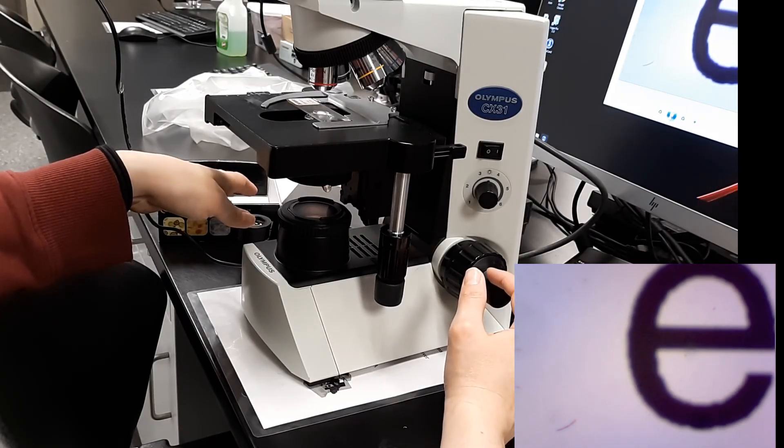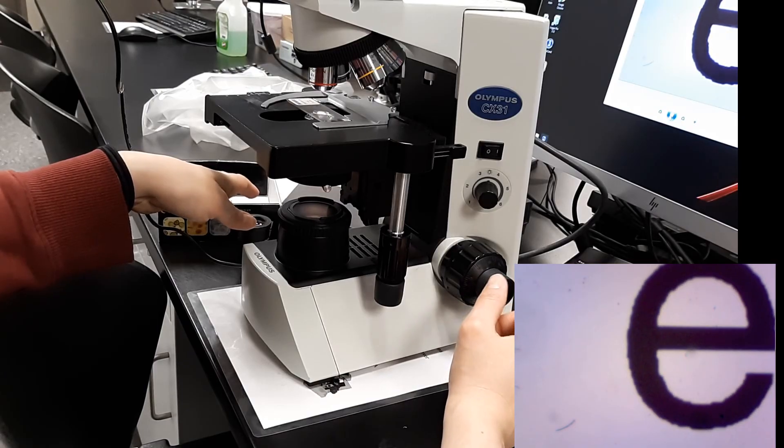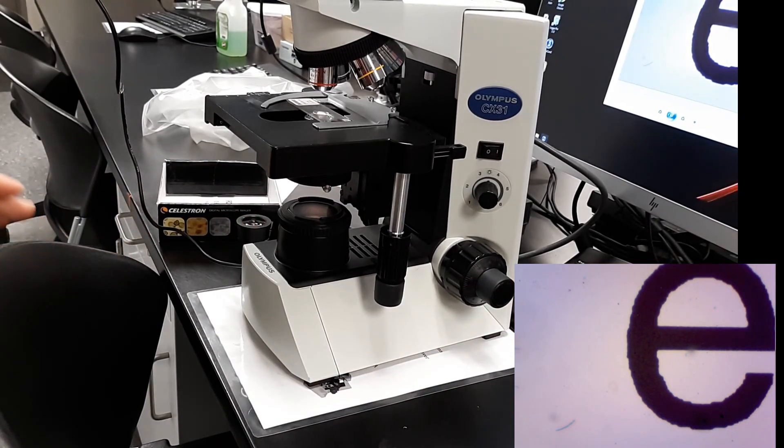Then you continue with your yellow, your blue magnification. Thank you.